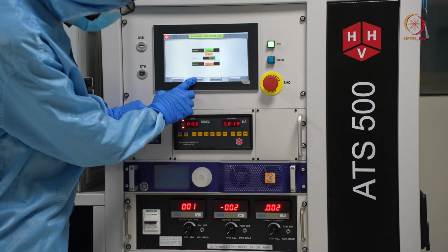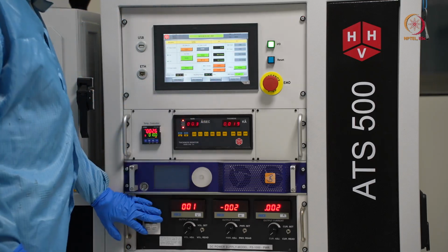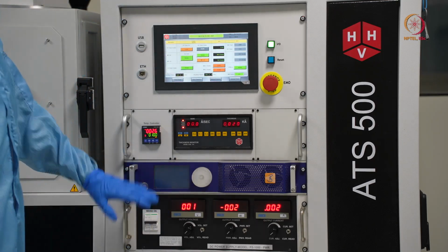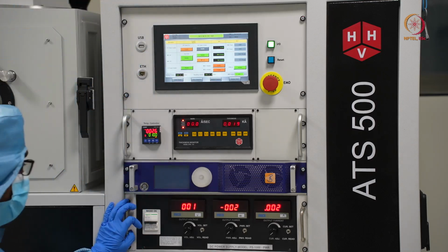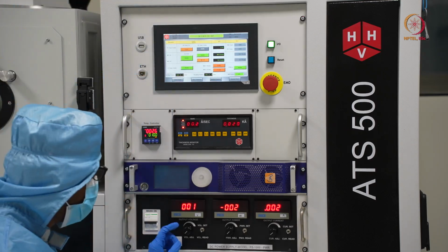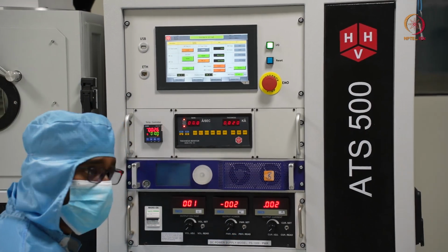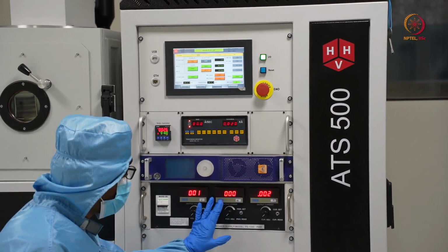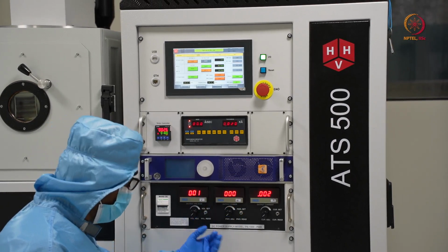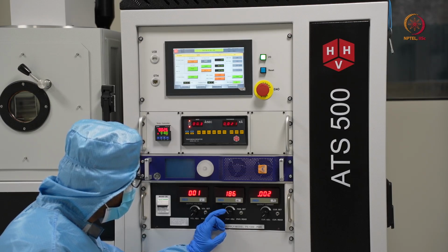So we'll go back to source control. Now let us start the things. So here now we'll mostly see here, and we will check what type of reflection is showing there and here. So here at the first step we will increase the output voltage. So you just make sure other things are all off. So first thing is we have to set this power, how much power you want to deliver finally. So let's say we will set it around 200 or 250.